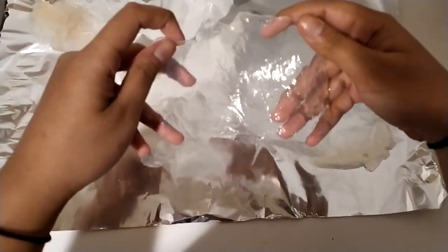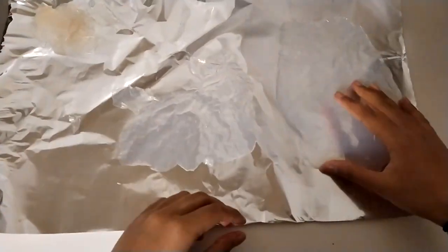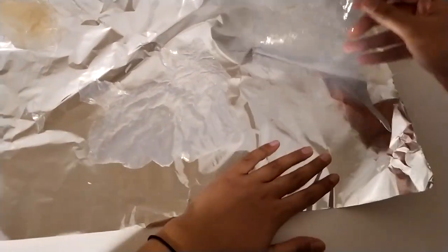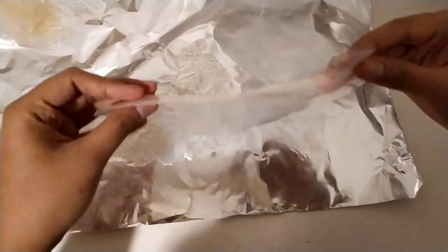And here is the finished product. Very moist and very gel-like.